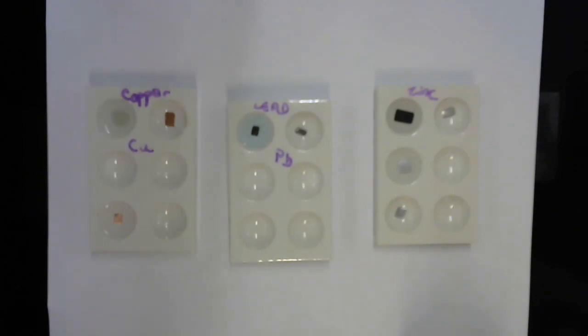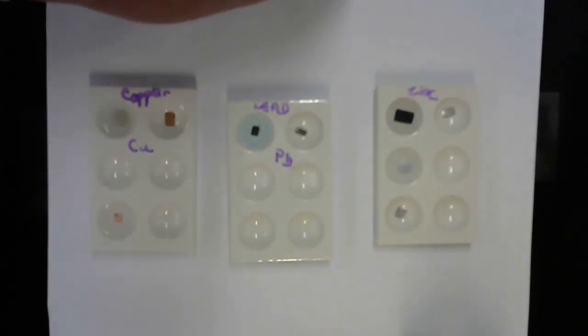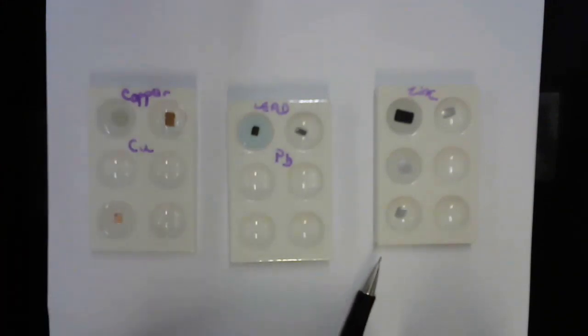All right. So reaction number 5, zinc plus magnesium sulfate. I'm not seeing a reaction there at all. We're going to give it some time. While we're doing that, I'll do the last reaction, which is to take that last piece of shined up zinc in this well here, and I'm going to add sulfuric acid to that.